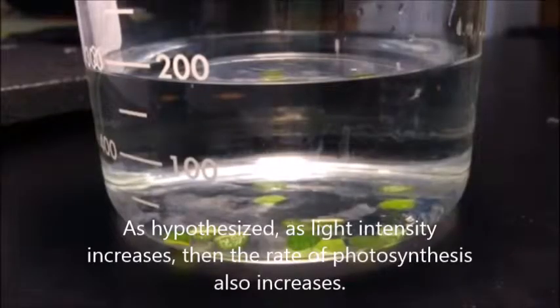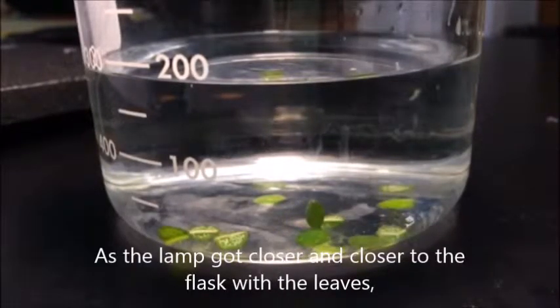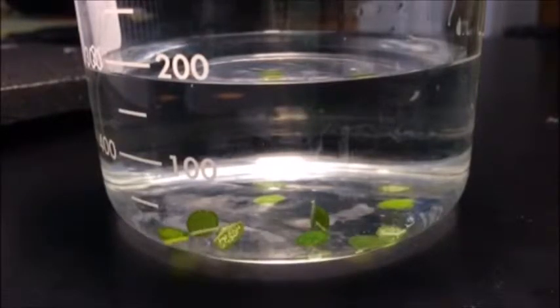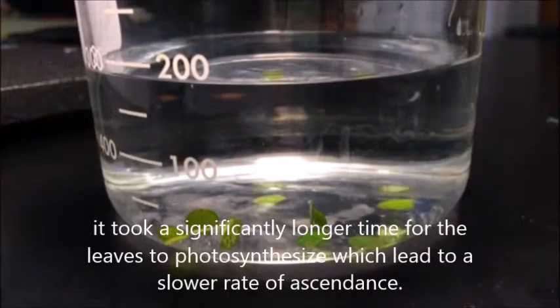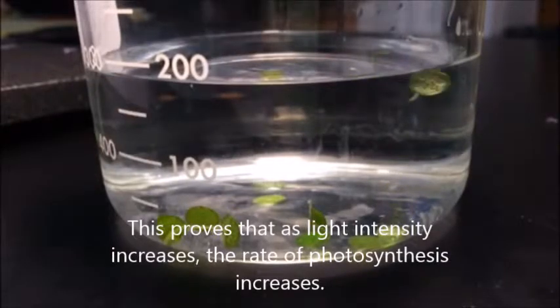As hypothesized, as light intensity increases, then the rate of photosynthesis also increases. As the lamp got closer and closer to the flask, the leaves photosynthesized faster, which created a release of oxygen, which in turn causes the leaves to float up at a quicker rate. As the light was moved further out, it took a significantly longer time for the leaves to photosynthesize, which led to a slower rate of ascendance. This proves that as light intensity increases, the rate of photosynthesis increases.